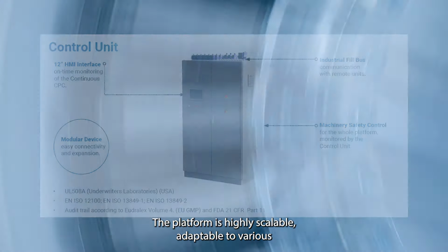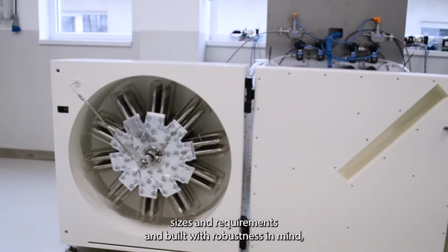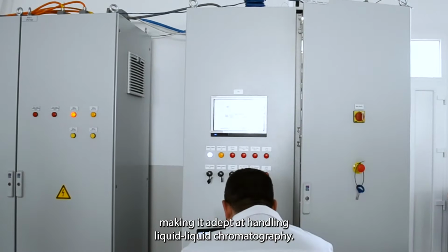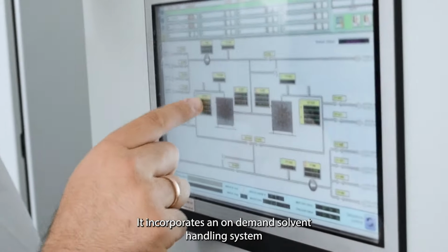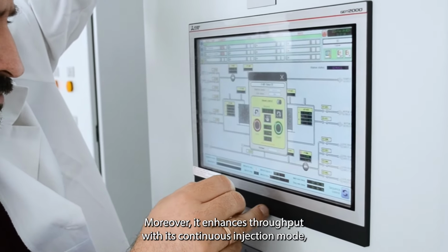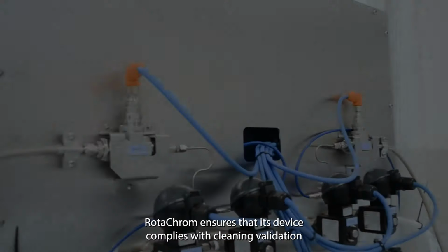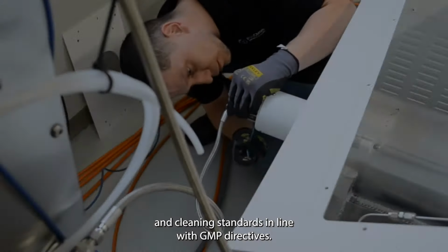The platform is highly scalable, adaptable to various sizes and requirements, and built with robustness in mind, meeting industrial standards for durability. This device is exceptionally versatile, making it adept at handling liquid-liquid chromatography. It incorporates an on-demand solvent handling system that can be tailored to specific industrial standards. Moreover, it enhances throughput with its continuous injection mode, allowing for more efficient sample processing. RotaChrom ensures that its device complies with cleaning validation and cleaning standards in line with GMP directives.